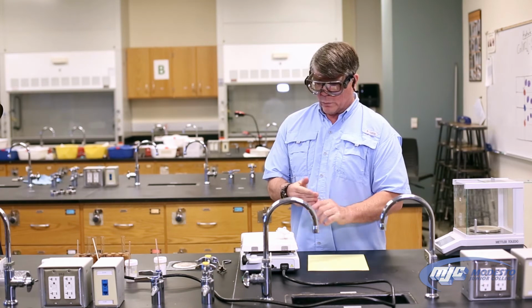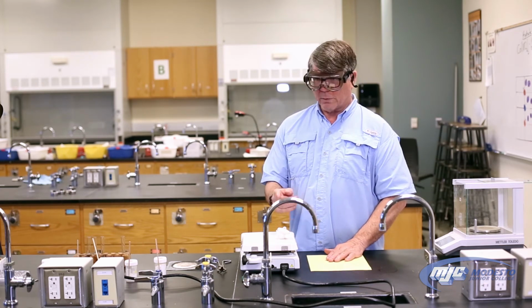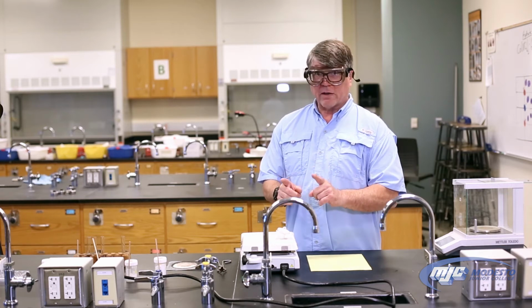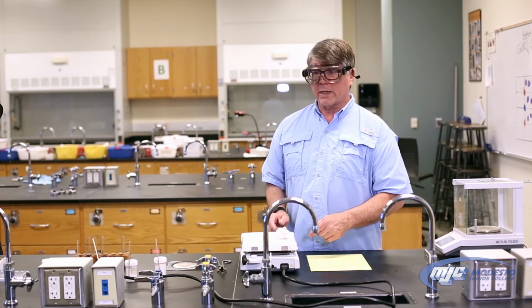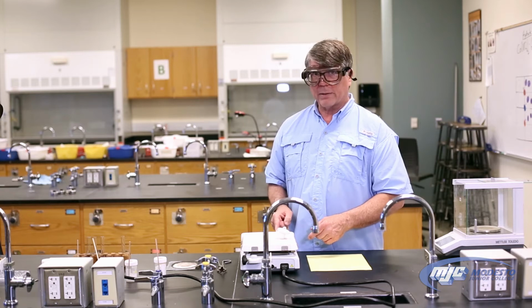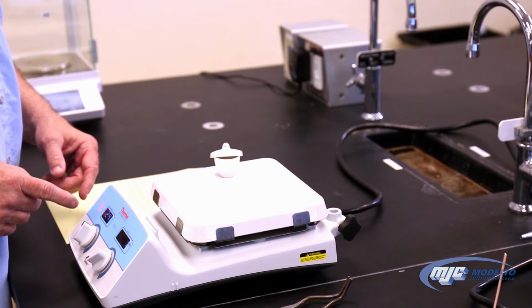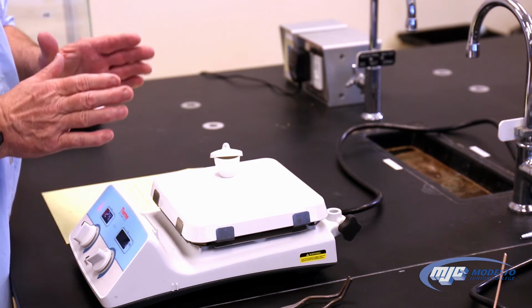So now we're gonna wait for this for 5 minutes to make sure that all the crackling, if it's gonna happen, has stopped. After that 5 minutes, we're gonna turn it up all the way. We're gonna turn this knob on the hot plate all the way up. We're gonna heat it for 15 more minutes, okay? Then we're gonna take it off and weigh it.